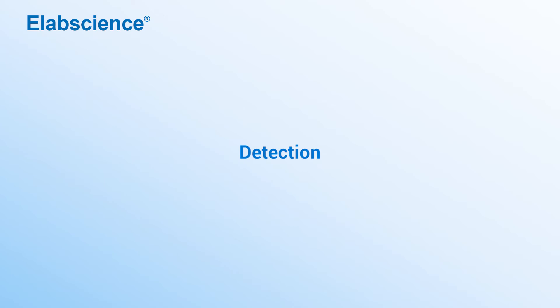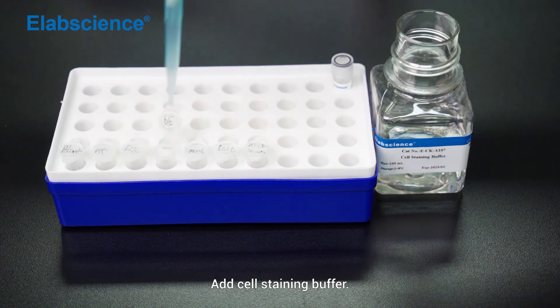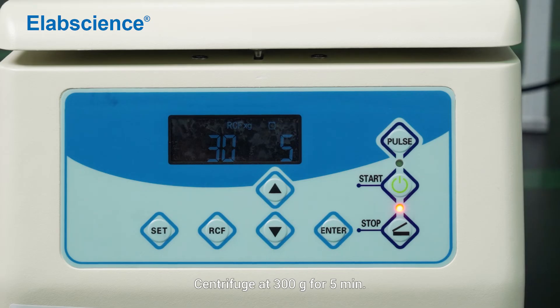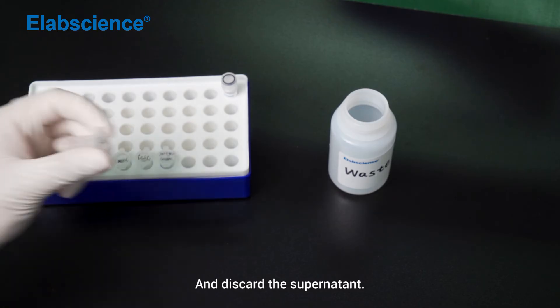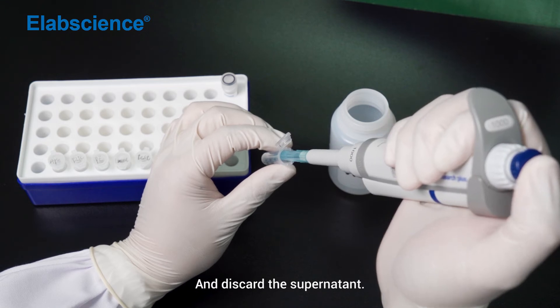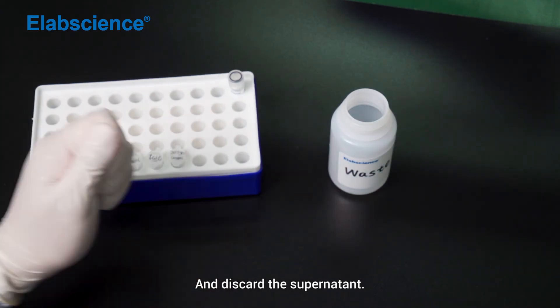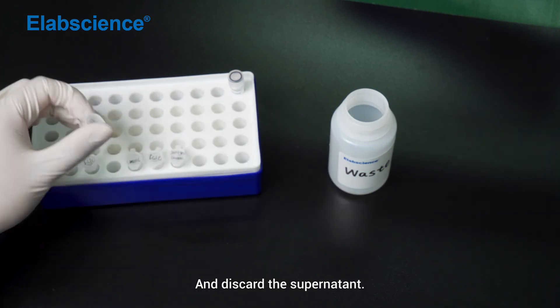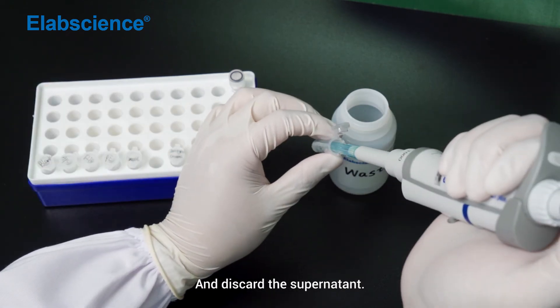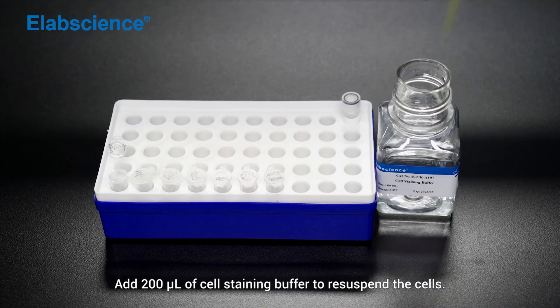Detection. Add cell staining buffer, then centrifuge at 300 times gravity for 5 minutes and discard the supernatant. Add 200 µL of cell staining buffer to re-suspend the sample.